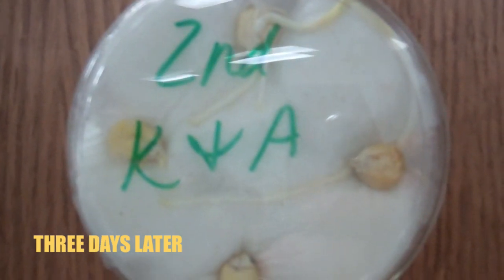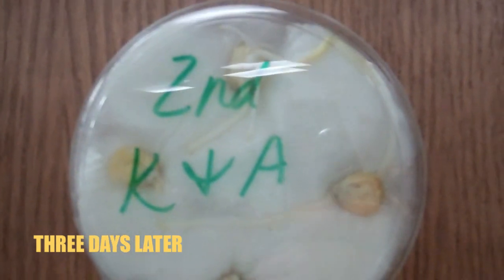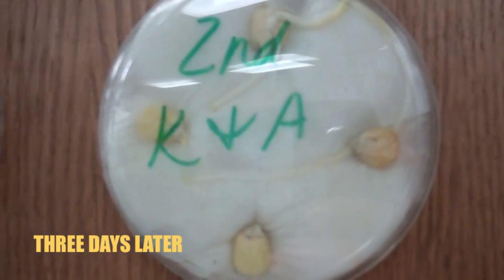In just a few short days, we can already see the growth of the plants. We can already make out the roots as well as the stems.